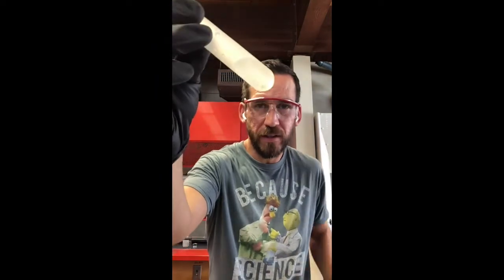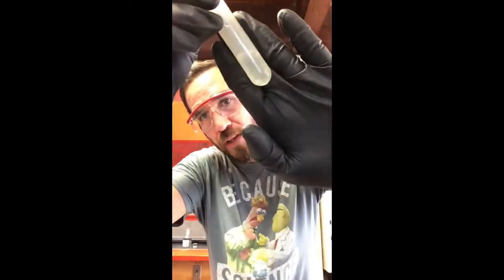Meanwhile, still going. You can still see it in there. Whatever you gotta do. Might as well have fun while you're doing it, right? Also make sure it's not leaking. All right, so finally got it all dissolved.